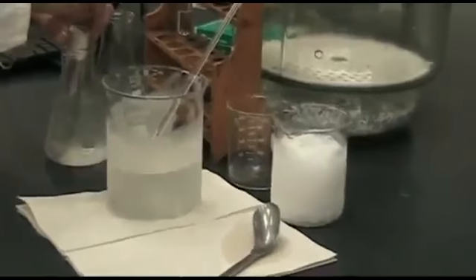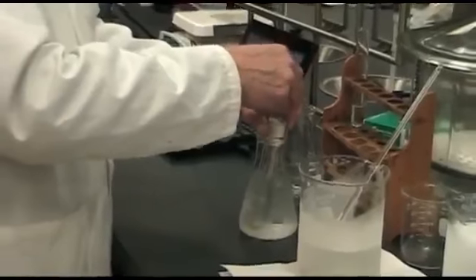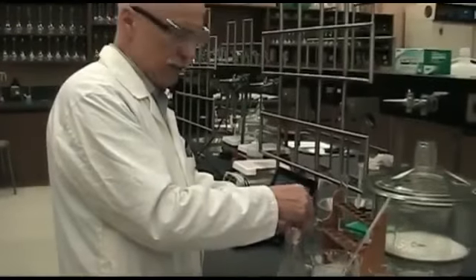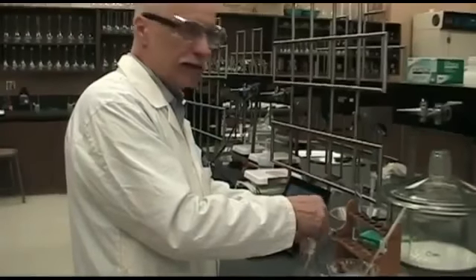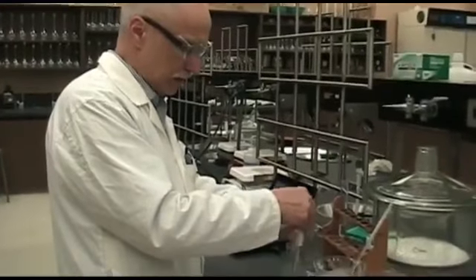So this is going to take quite a while, since it needs to go below 0. As we're all familiar, we put salt on the road in the winter to melt the snow and the ice. And we know that it stays slushy and thawed down to -10 and -20 and all that, depending on how much salt we have.